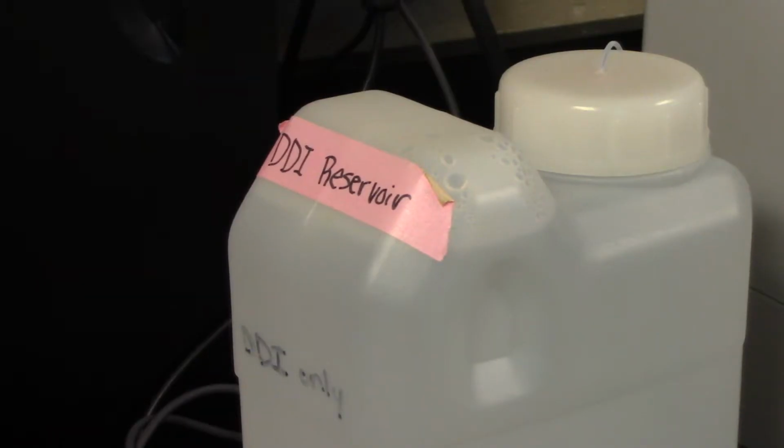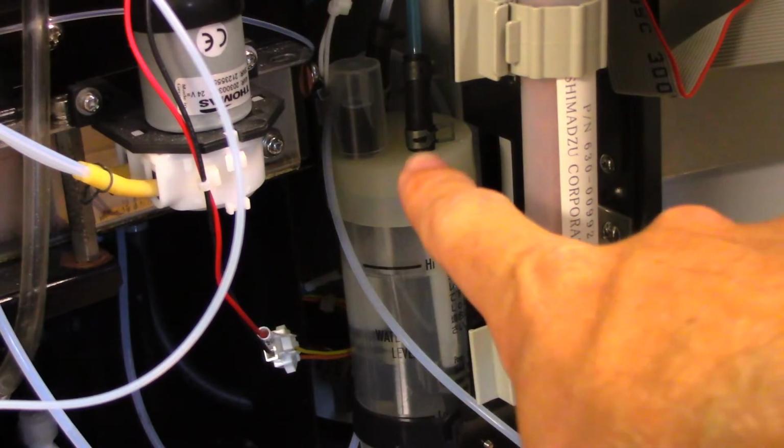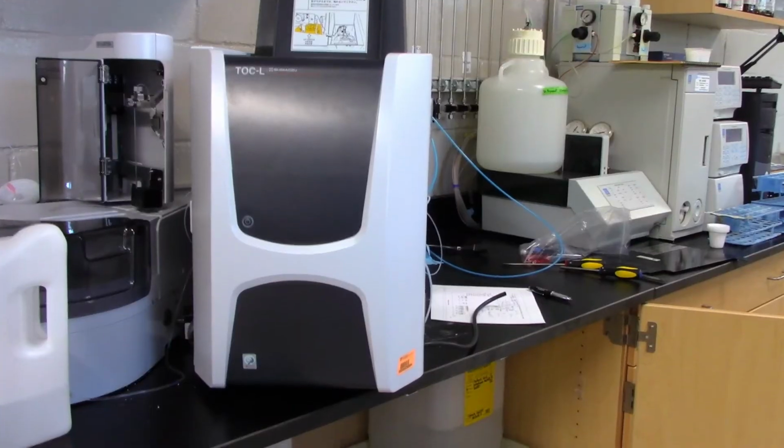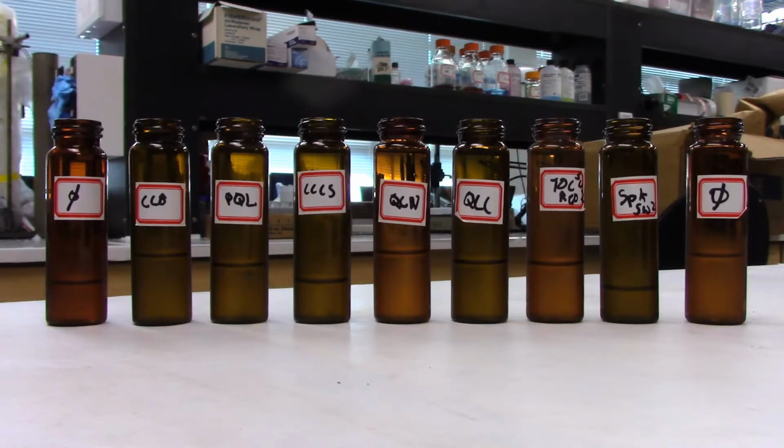It is critical that during this process you check the water levels on the outside of the machine, on the inside of the TOC TN, and in the waste container under the machine. Also keep track of the QA/QCs, ensuring they are within analyte limits provided by the lab manager. When the analysis has been successfully completed, you can export the data, as Sophia will demonstrate here.